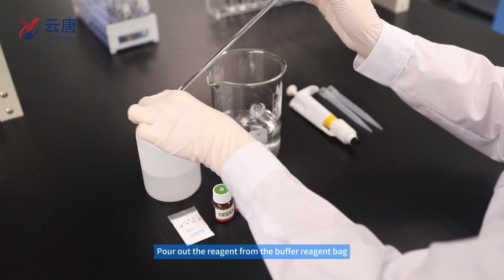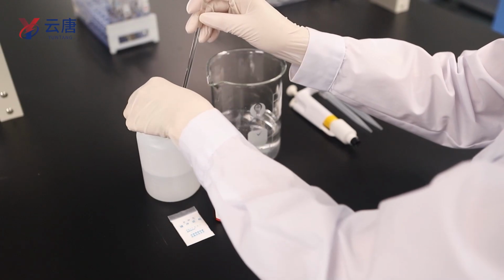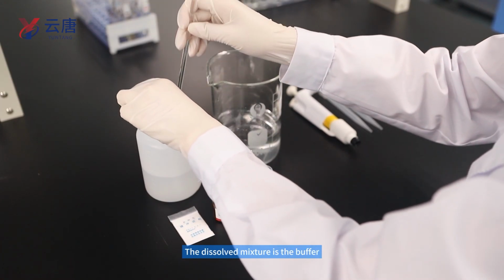Pour out the reagent from the buffer reagent bag. Dissolve in 500 milliliters of distilled water. The dissolved mixture is the buffer.